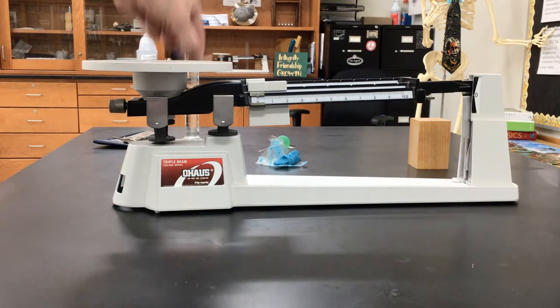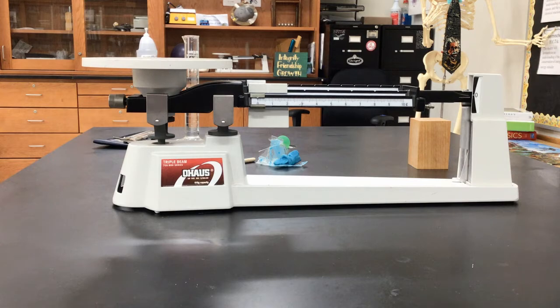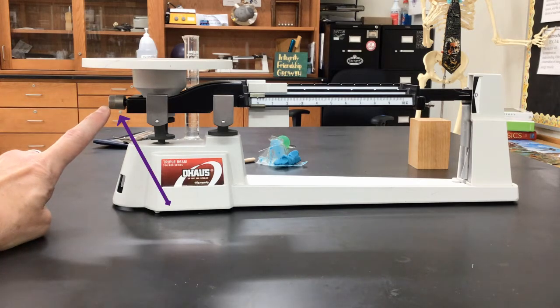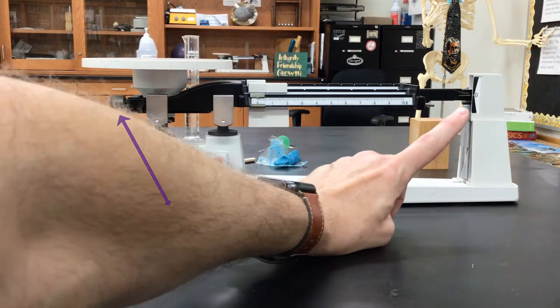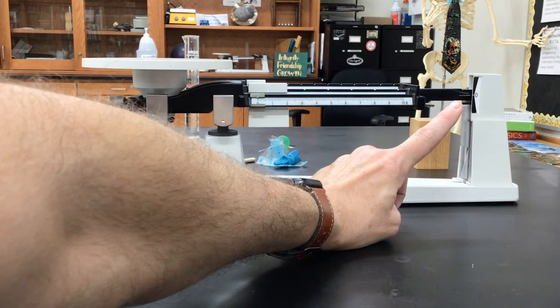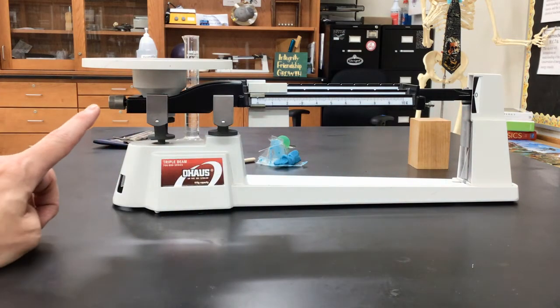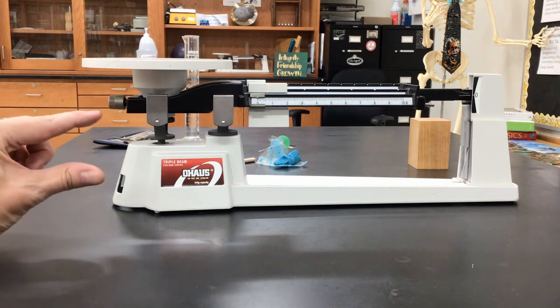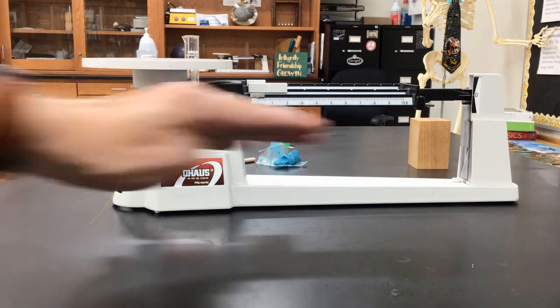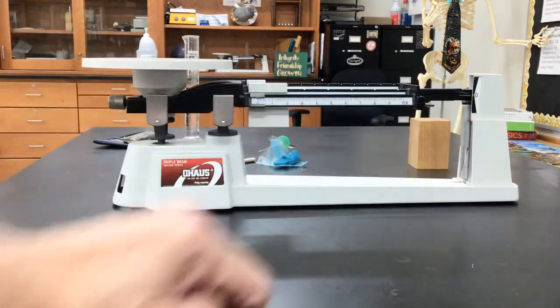One last thing I wanted to share with you about these triple beam balances. Let's just say, before you get started, that the line on the left and the line on the right where the zero is are not lined up. That's what this dial right here is for. If that line is lower than the zero, you would rotate the dial forward away from you, which would raise that line up.